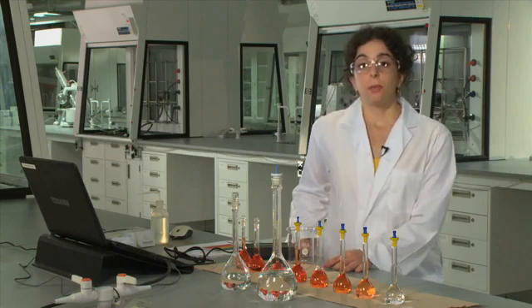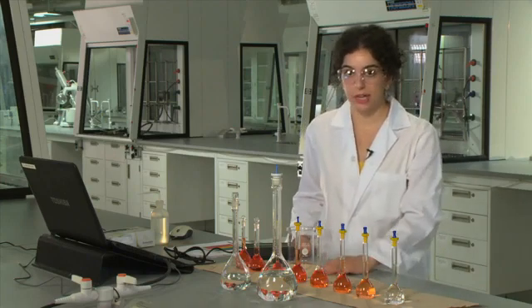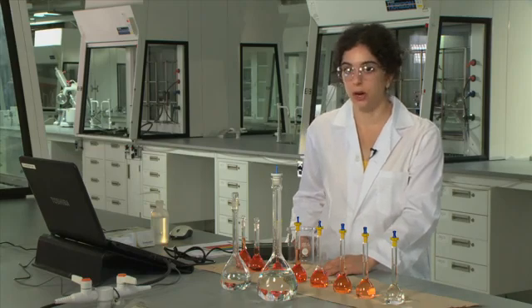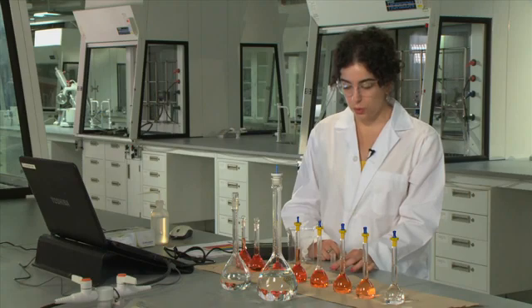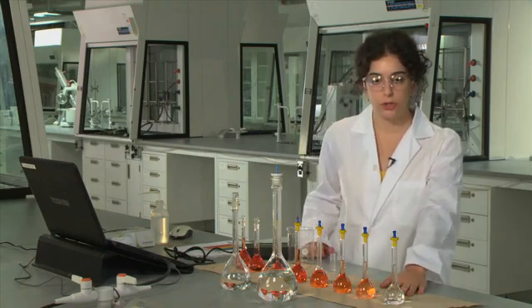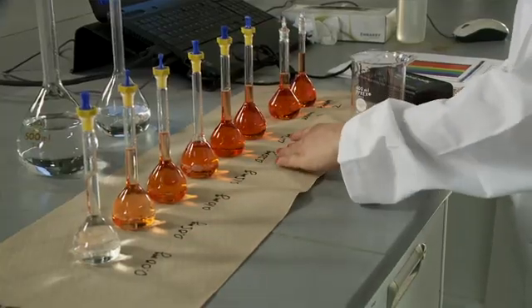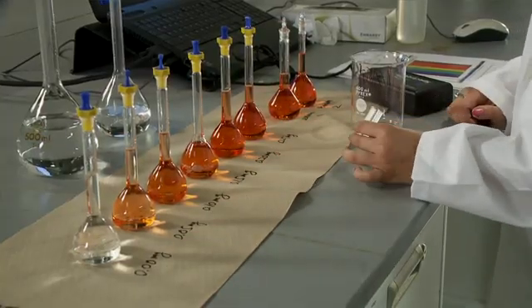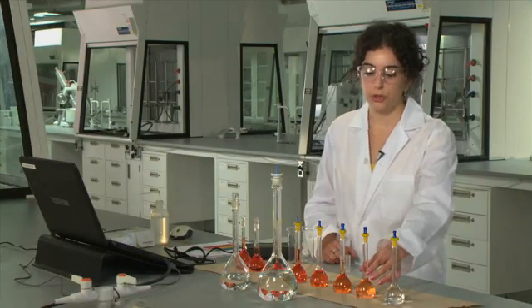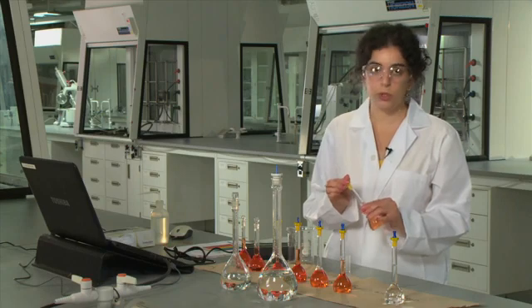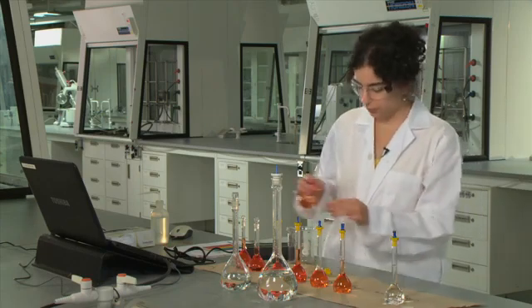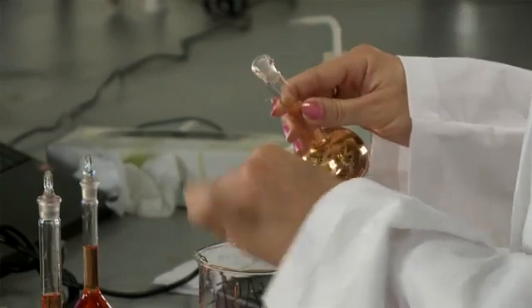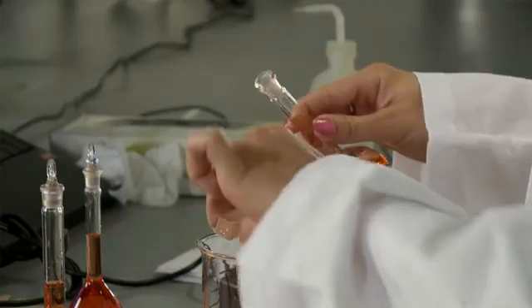So now for the next part of the experiment, we're going to run our series of standards and construct our calibration curve. To do this, we're going to start off with our lowest concentration of our standard solution, and we're going to work up to the highest concentration. So any time you change samples, you're going to want to rinse the cuvette out once or twice with the solution that you're going to use to measure it.